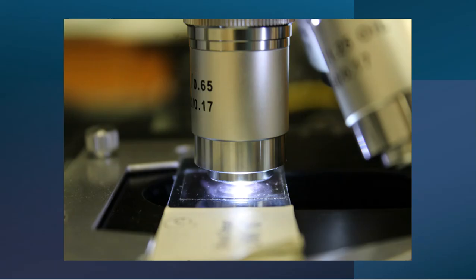And then finally, I'm going to turn it one more time to the 40 and notice, look at this. I had to lower the platform a little bit and it still comes almost in contact with the slide itself. So once more, be very careful with the 40 lens. You don't want to damage our slides because if you damage our slides, I will fail you for the entire course in one fell swoop.